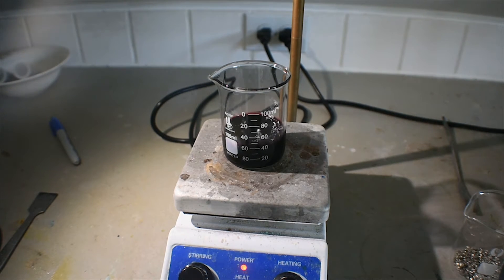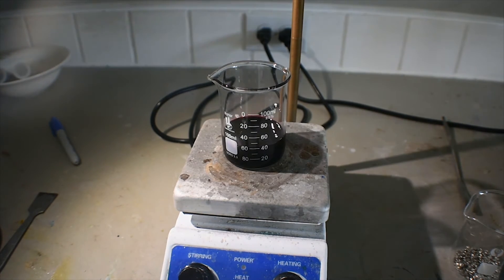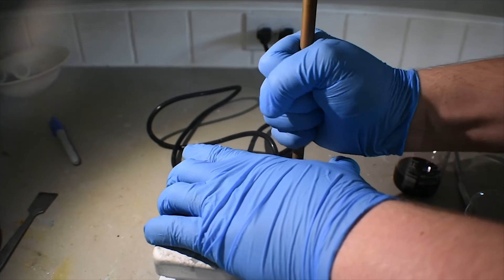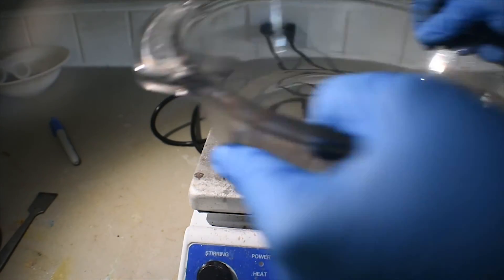This water is measuring about 40 to 50 degrees C, so let's say an average of about 45 degrees Celsius. That should be quite all right. I'm going to turn off stirring here. It's all right if not all the iodine is dissolved — it will go into solution as things react.